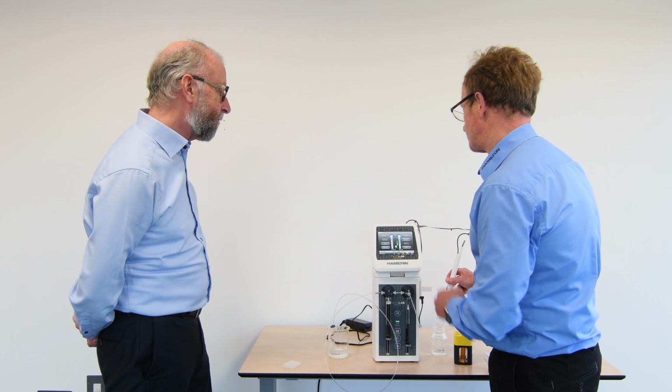So there you are, Chris. We used the sample and the diluent volume to give you that 1 in 4 dilution, and we included the wash cycle at the end of that. I mean, that does cover much of what most people need to do.